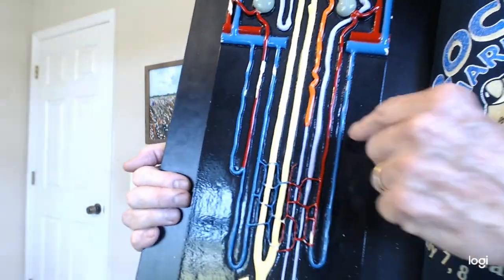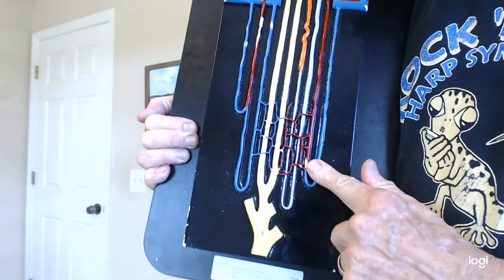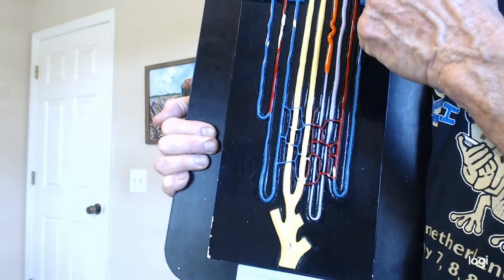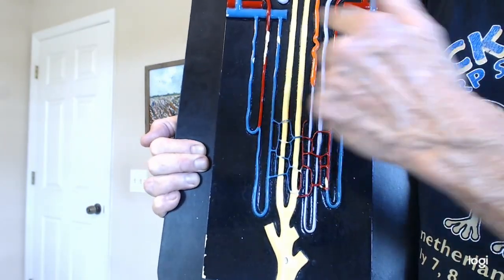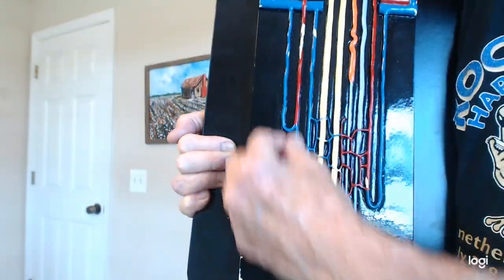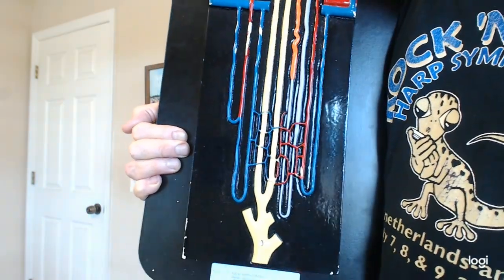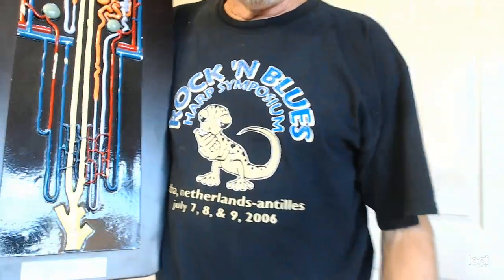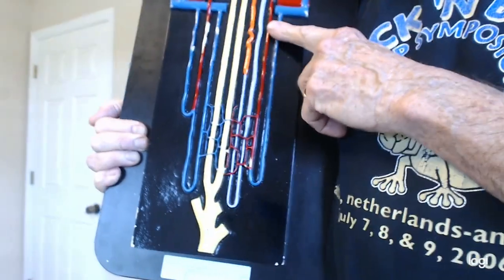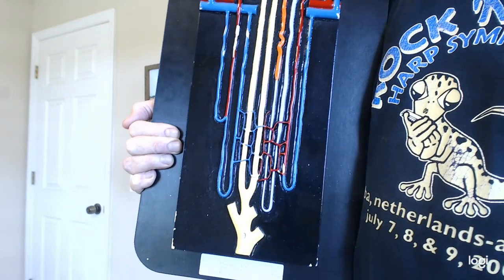Now you have a group of these red and blue things that are not tubules. The tubules are connected to the glomerulus and the collecting duct. These blood vessels down here are a group of straight up and down blood vessels, which, if you remember, rectus abdominis goes straight up and down, rectus femoris goes straight up and down the front of your leg. This is called the vasa recta. Straight up and down blood vessels is what it means.